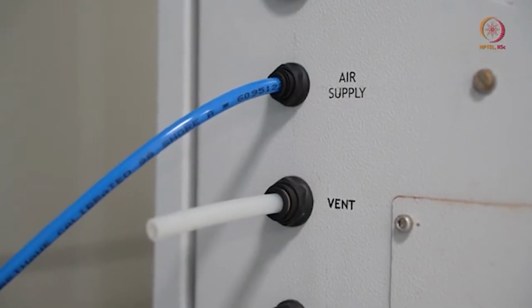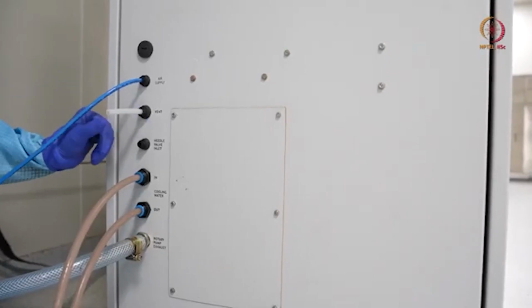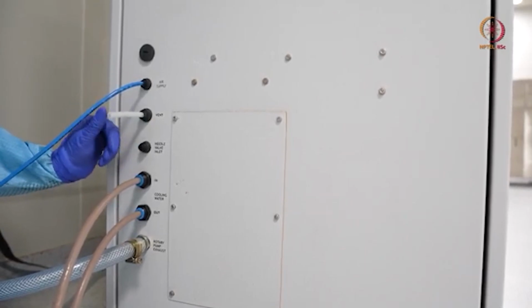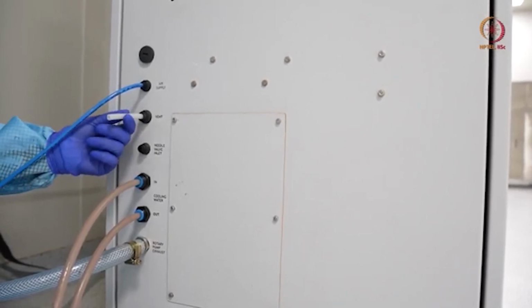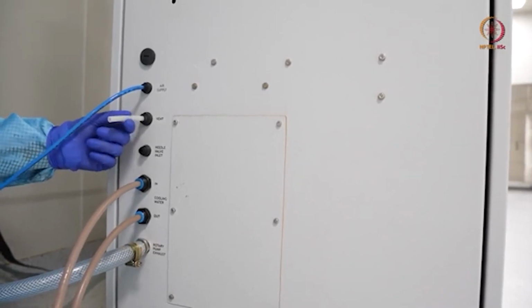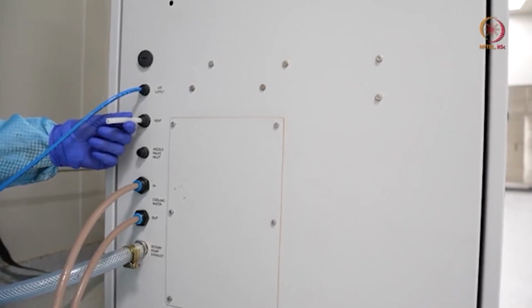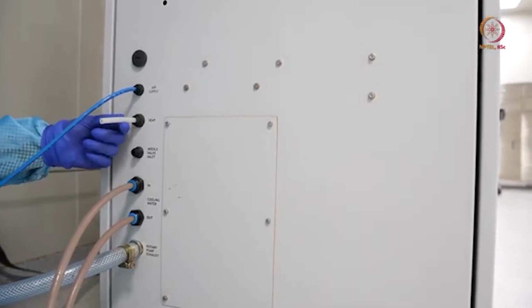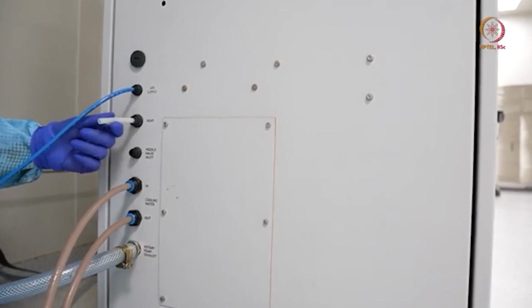So venting means putting air or inletting air in the chamber. So here this is the vent valve. You can see that just a pipe is there and it is cut here. Venting can be done either in a clean room environment, or it is actually recommended to vent it using nitrogen. As we have enough purity of air inside, like purity in the sense of fewer dust particles, we are venting it in the clean room environment only. Otherwise it is recommended to use a nitrogen cylinder.